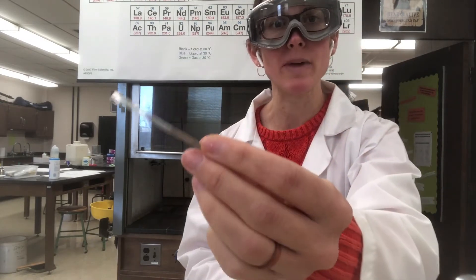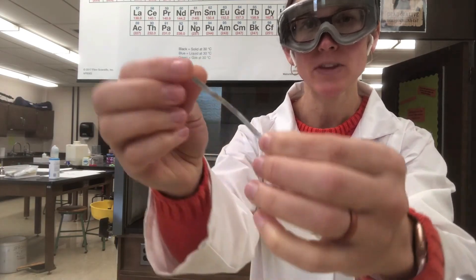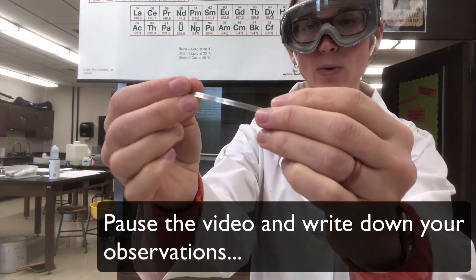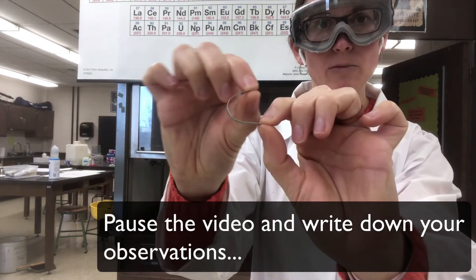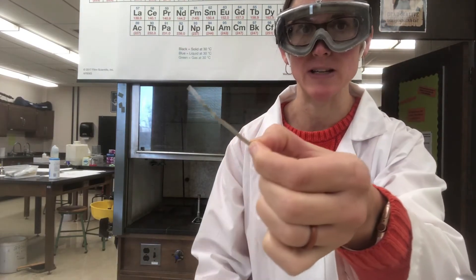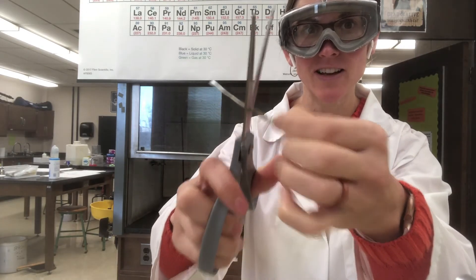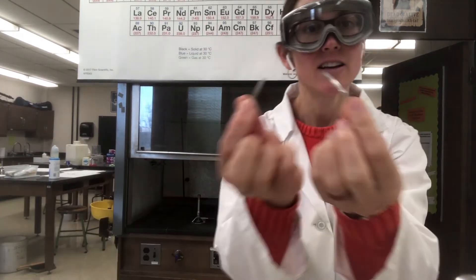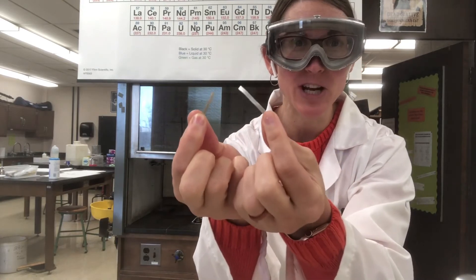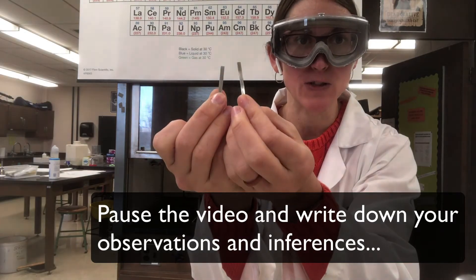For this next demo I have a piece of magnesium ribbon — it's a very thin, narrow piece of magnesium metal. Make some observations about what you see with this magnesium ribbon. For the first change, I'm going to cut it. Here's what I have when I'm done — was that a chemical change or was that a physical change? What do you observe and what is your inference from that?